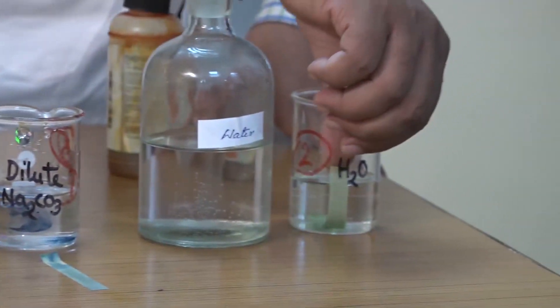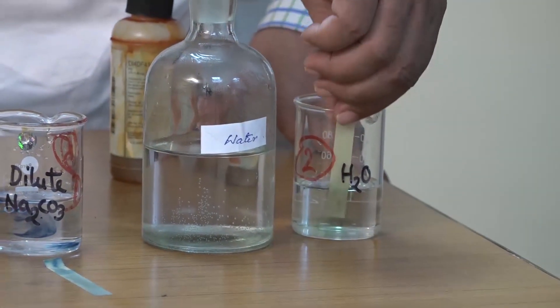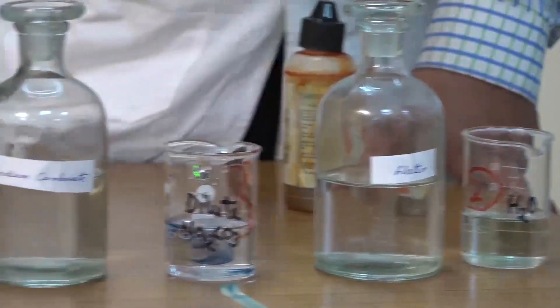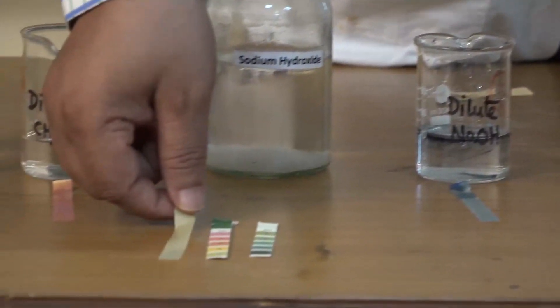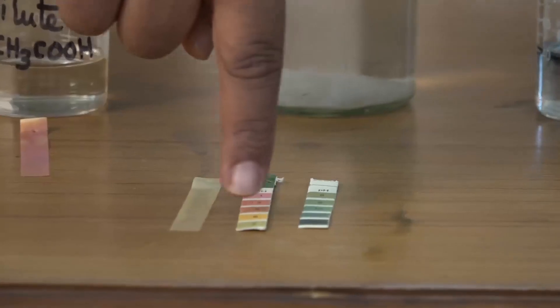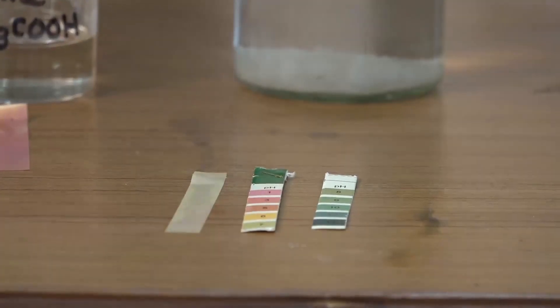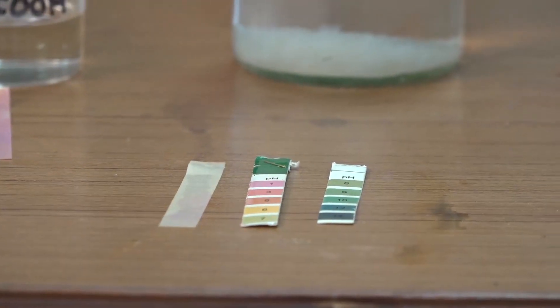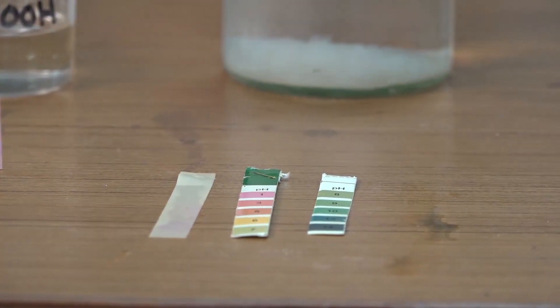From water I am collecting the pH paper and matching its color with the pH scale. It is matching with pH 7, so water is neutral in nature.